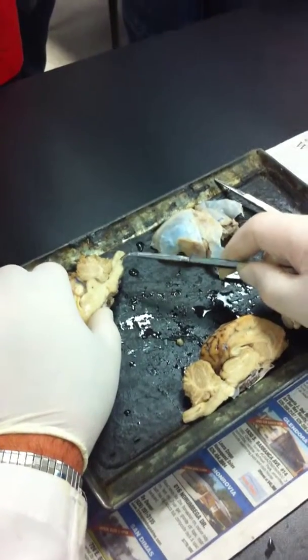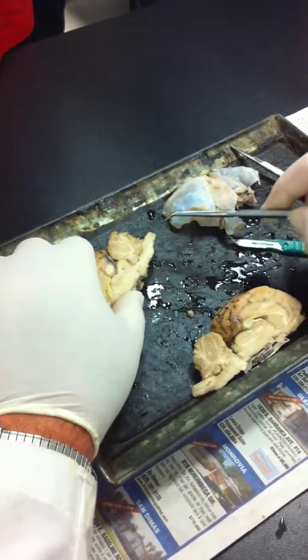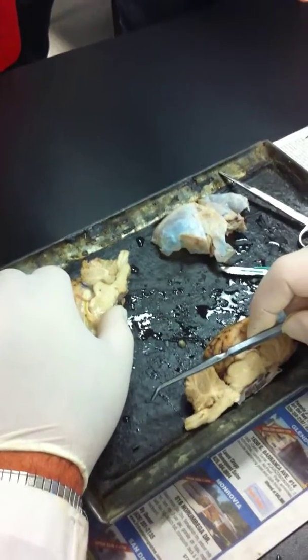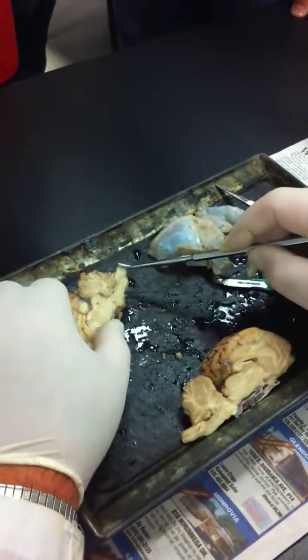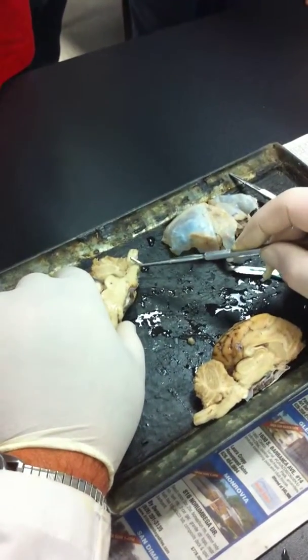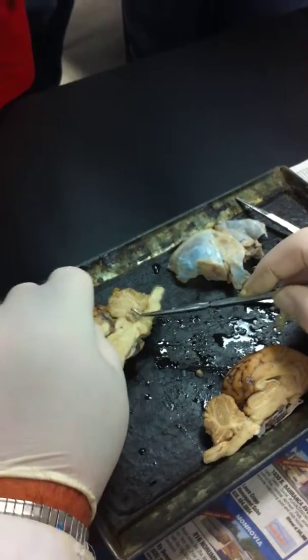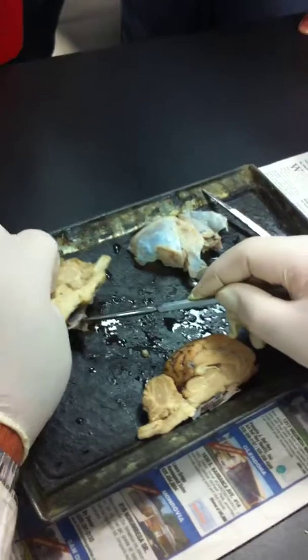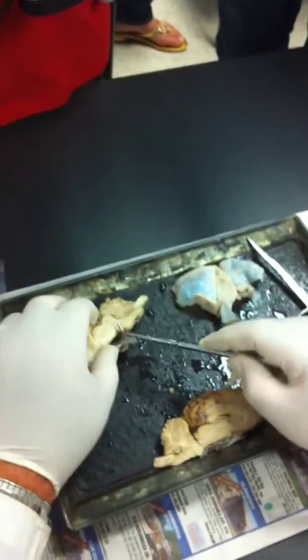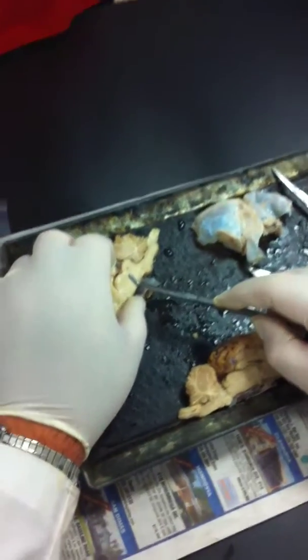You can sort of see, not terribly well, the central canal. If you can see a line there, that's the central canal. So spinal cord, and then all of the brainstem begins right here with the medulla oblongata, pons, and then it extends all the way up to, yes, the midbrain, all the way up to around here. Right here.